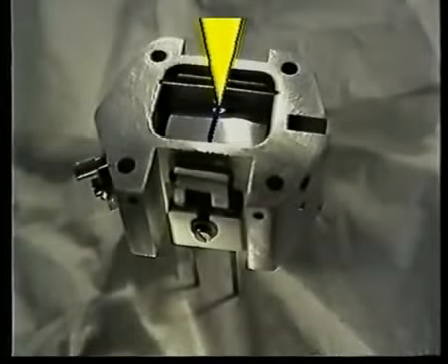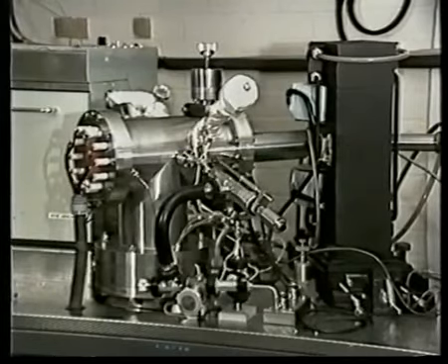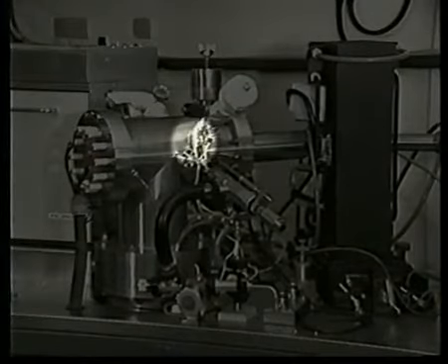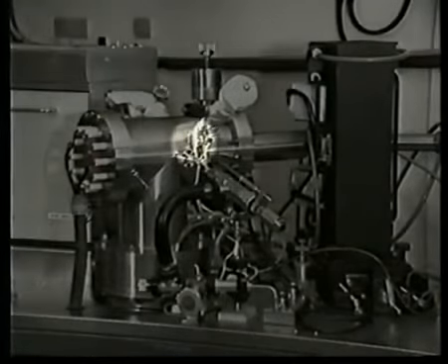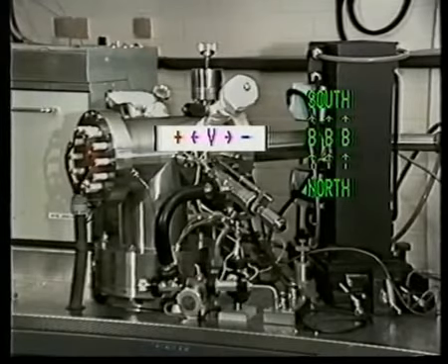You can see the positive repeller plate highlighted here beneath the electron beam. The ion block, of course, is normally at right angles to this when the source is inserted into its housing. So the ion beam actually travels horizontally along the tube towards the cathode. The ion block and cathode are approximately in this position when the source is housed within the mass spectrometer. The high voltage V between the repeller in the ion block and the cathode accelerates the positive ions to high velocity. These ions travel on towards the vertical magnetic field of the electromagnet, where they are deflected towards the detector.